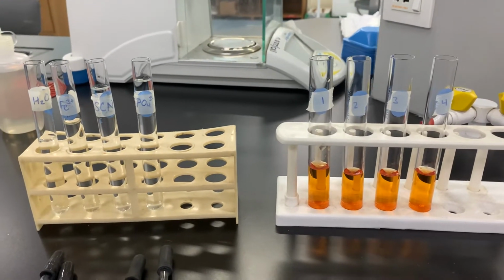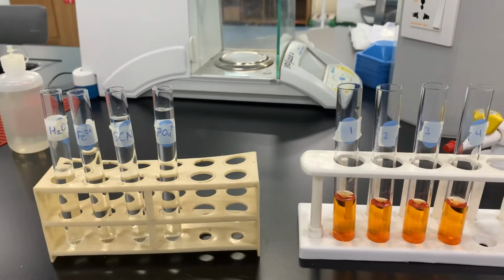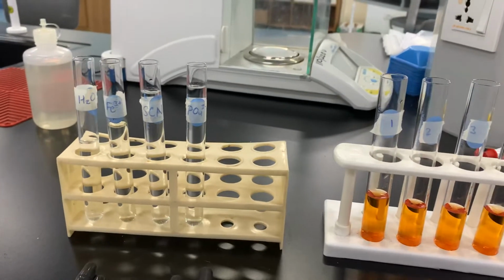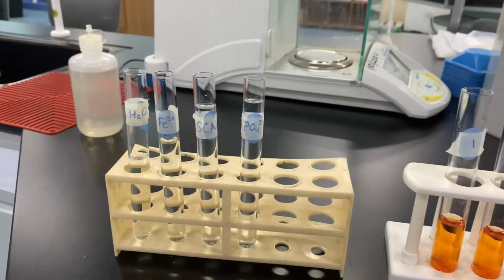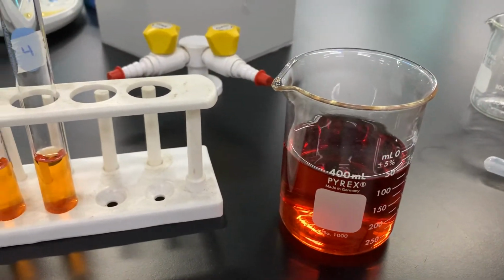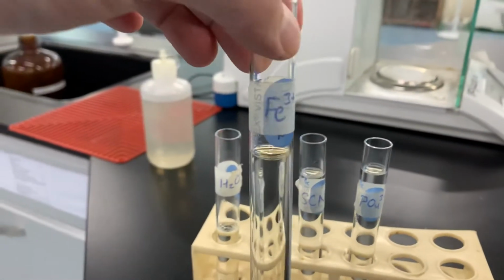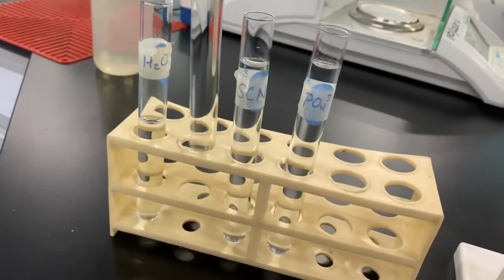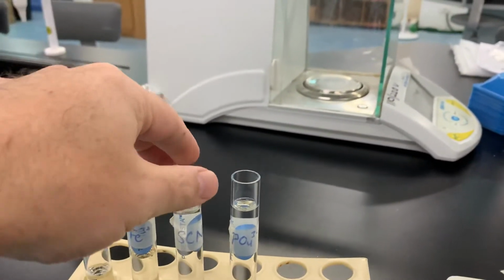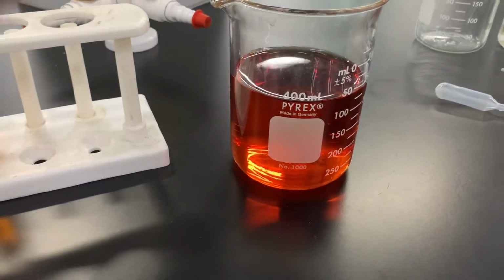What we're going to do is have a reaction between iron ions, which are Fe+3 ions, and thiocyanate ions, which is SCN-. When you react them together, you get a nice little reddish solution that looks like that. Here you can see what iron plus 3 ions look like in solution. They're more or less colorless. The same thing for the thiocyanate ions, more or less colorless. But when they react, you get this really cool orangish red solution.